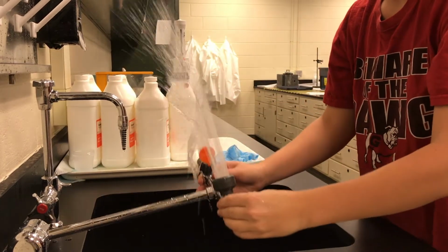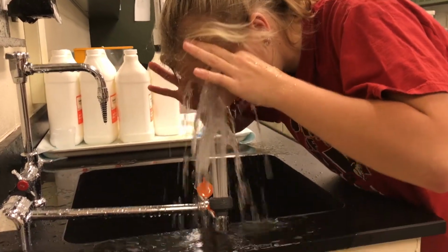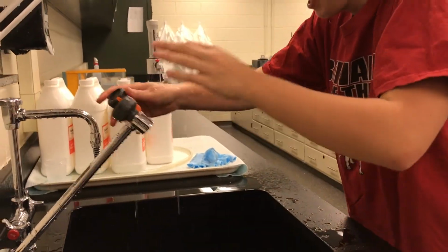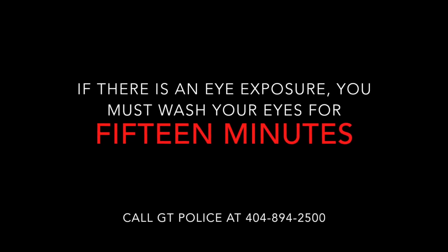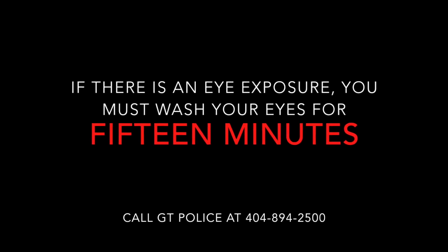While washing out your eyes, make sure to pull back your eyelids to fully rinse your eyes. If you are helping the victim while they are rinsing their eyes out for 15 minutes, call GT Police for help because the victim must receive medical attention. If you are helping the victim, find out what chemical they were splashed with if possible and print out 4 copies of the SDS sheet for that chemical.